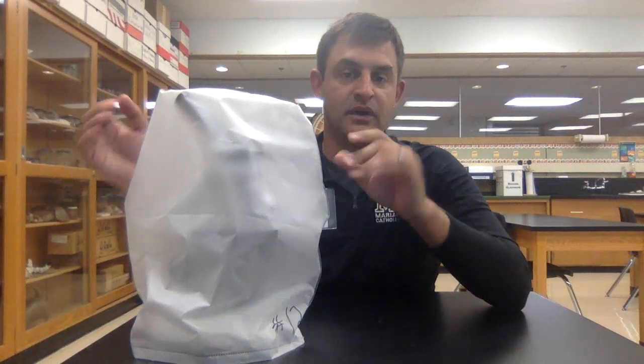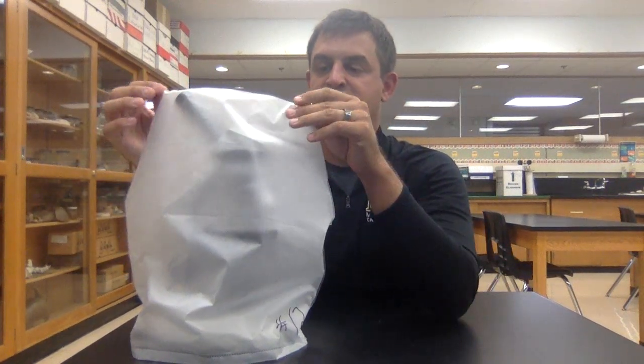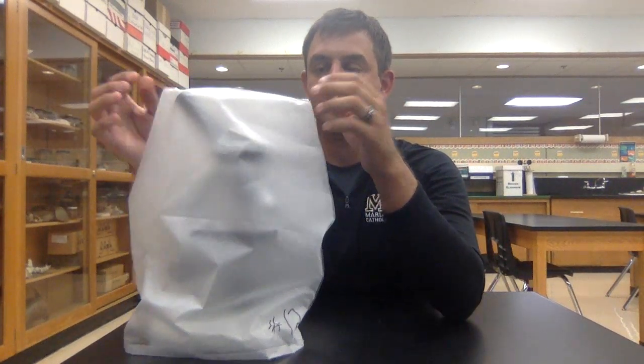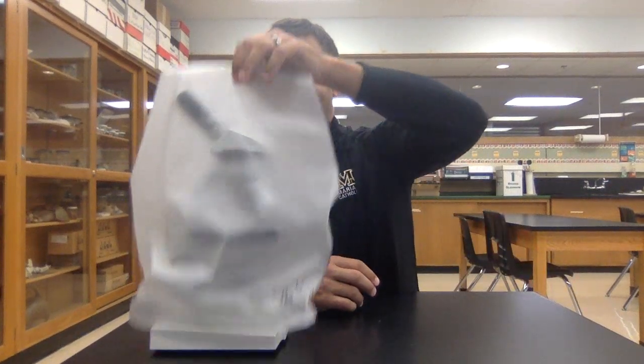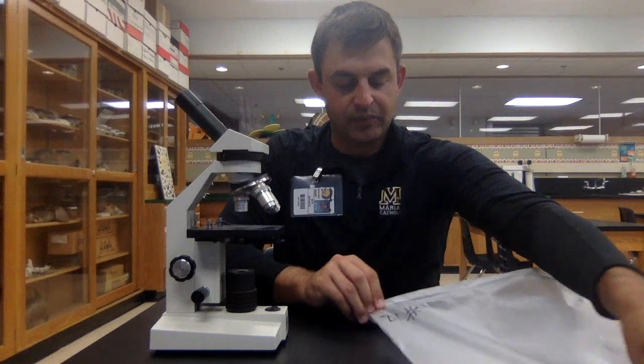Today, I'm going to walk us through the important parts of a compound light microscope. To begin with, this plastic cover goes over the microscope and protects all of the lenses and the stage from any dust that could accumulate on it, which would block the image that we're trying to see. When you remove the cover, your microscope is ready to use. You can just put that cover on the side until you're done using it.